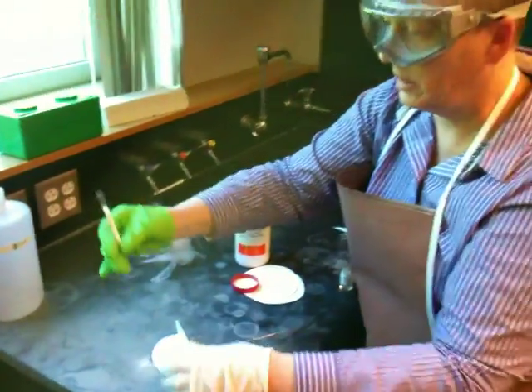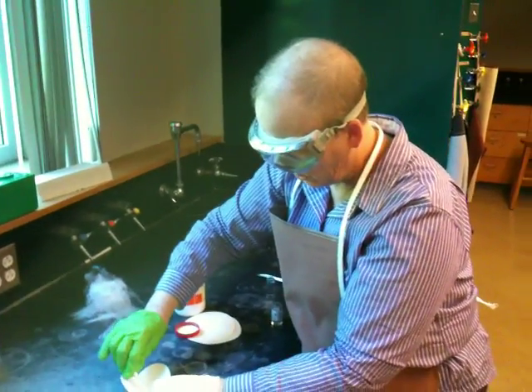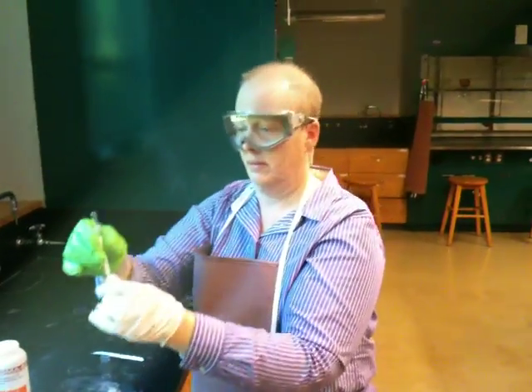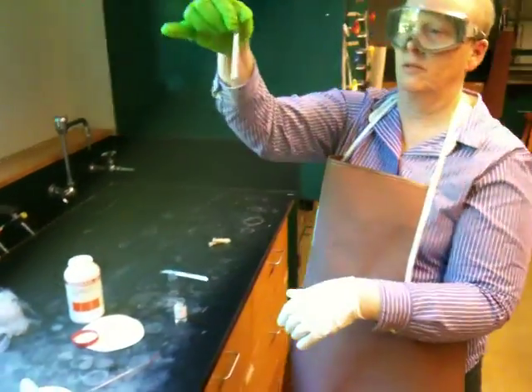All right, now I put a little too much in. Now I've got about, I would say, 1.5 inches, so I'm going to take a little bit out. You know, you can share this stuff with your friends when you're doing it. All right, so that's about right. I'm going to put a little less. Okay. You'll probably do this about 6 times during the course.